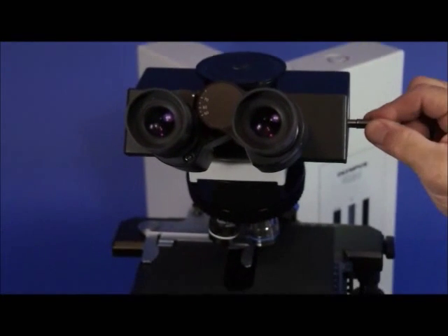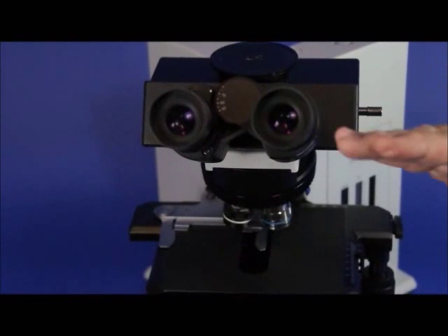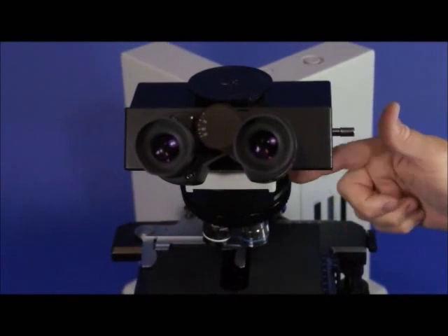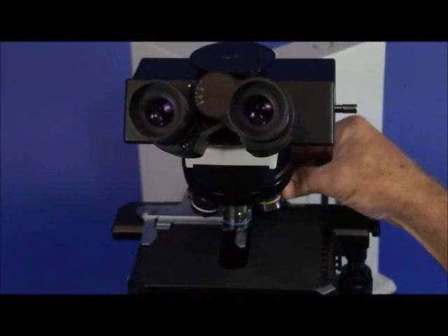Most people work with it in this position, which gives you all of the light to the eyepieces. Moving our way down, we have a six-place nose piece.